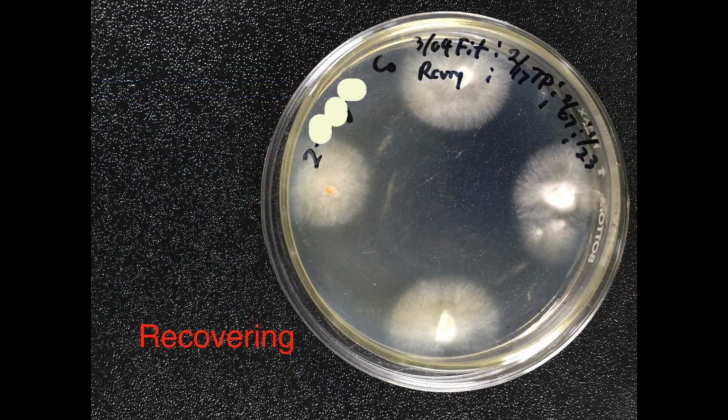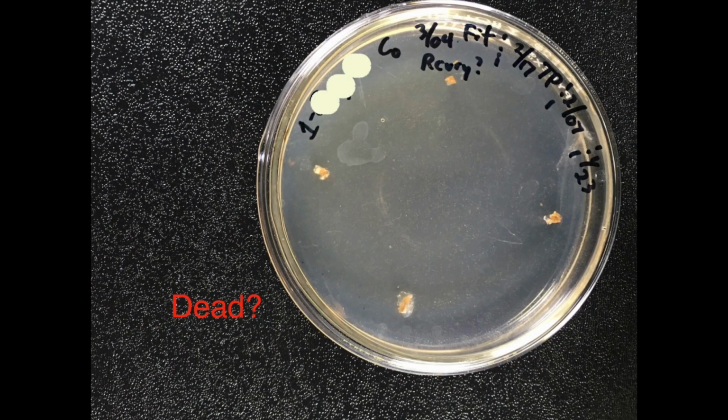So now that I had good agar plates, I transferred all the tissue and agar bits from 29 dead telephone agar plates to the new, I call them fit agar plates. Fitness agar was the name of the product. And some recovered, about 45% lived, but others died. And these two plates were the same tissue culture, same source. One survived, one died.